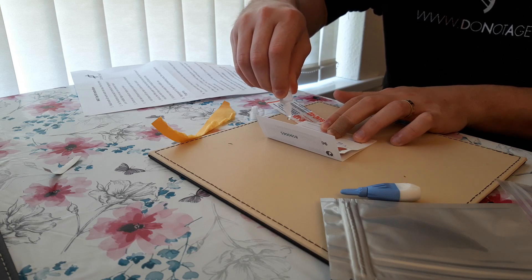Back after two hours, feeling much more awake now. As we can see, the blood is nice and dried — you can see it's gone through the back. The next part involves the magic sauce, the NAD fixing buffer. After two hours, let two or three drops of NAD fixing buffer drop on top of each of the two spots marked 'fix.' I think I put three on one of them — don't squeeze it too hard, that's my lesson for the day. Let the card dry for five minutes, then apply two to three more drops to the same spots on the reverse side.